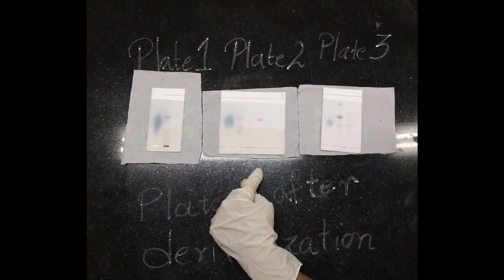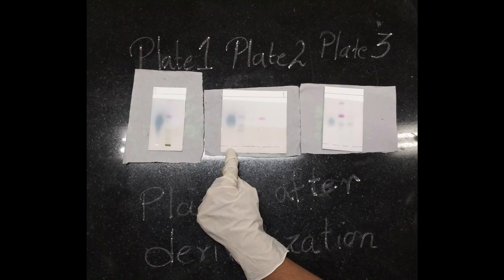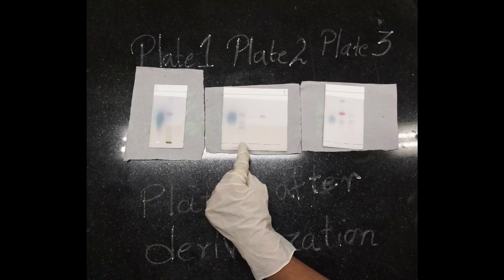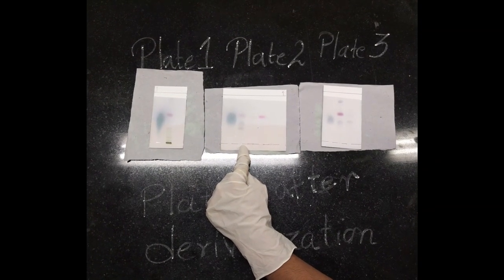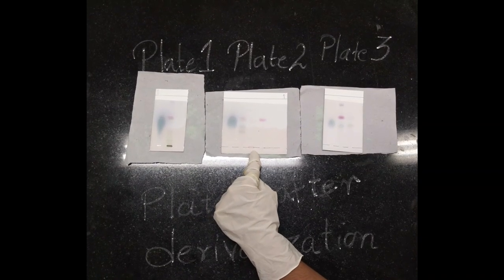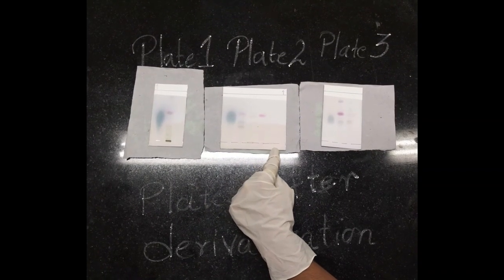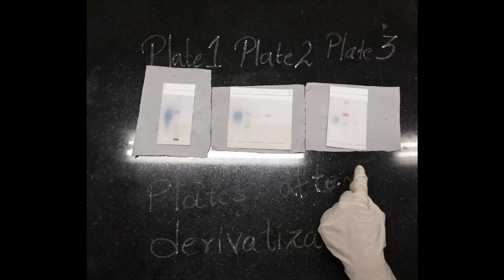Next is plate 2. First is the standard spotted, next is menthol vaporizer, toothpaste, mouthwash, and mint oil.